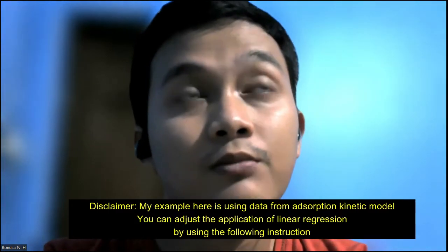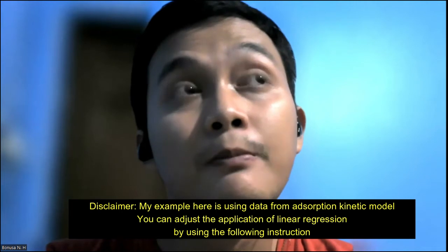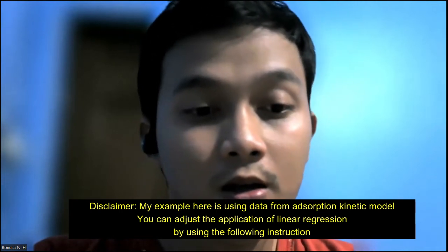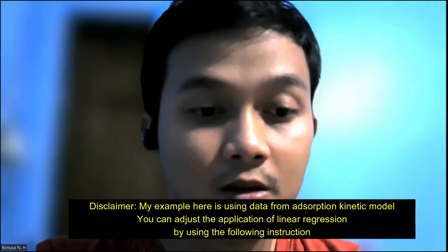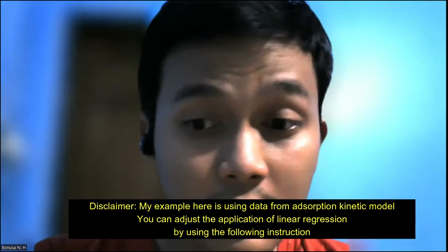I would like to share my skills in Origin, in linear regression fittings. This analysis can be used in many aspects, but today I would like to share its use in adsorption kinetics. So, let me share my screen.